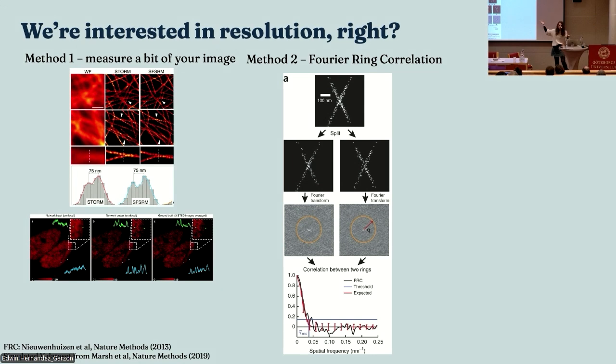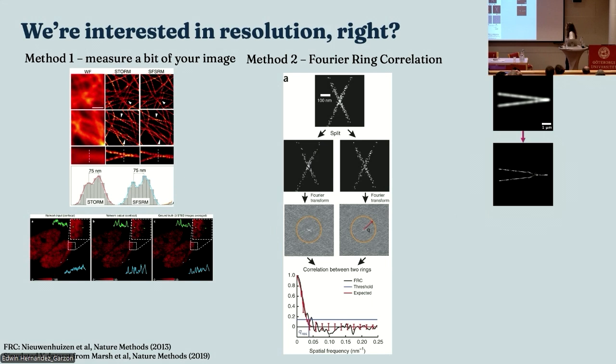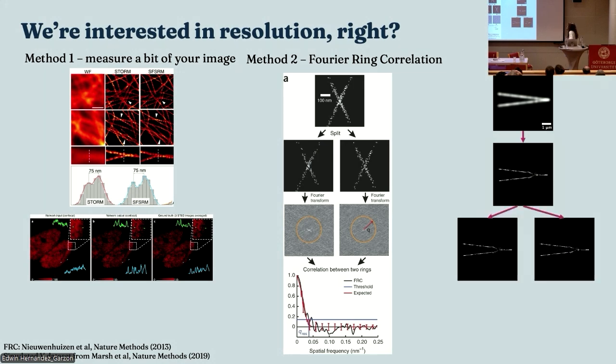Because we can just treat all our data at the same time. Okay, well, here's a little bit of simulated data. It's a little V-shaped structure. Super resolution reconstruction of this does not look good. You can see it's turned into a kind of wishbone structure. It's actually this kind of little hairpin V shape. All right, let's do Fourier ring correlation on that. Right, I split them out.